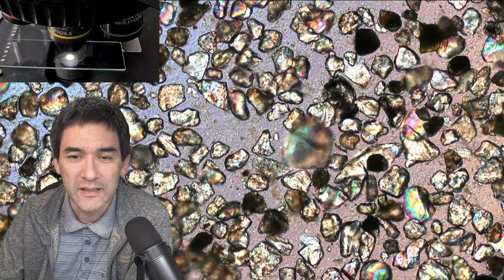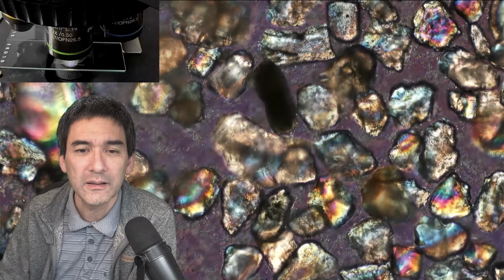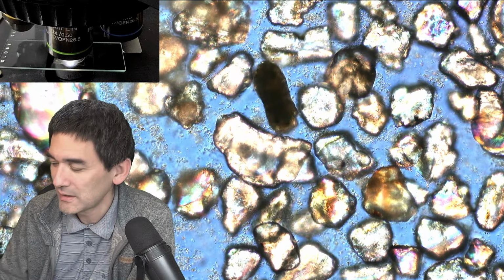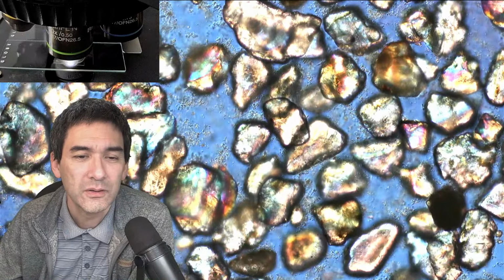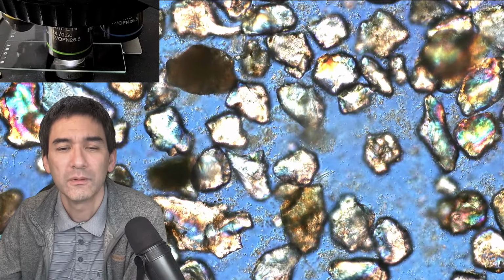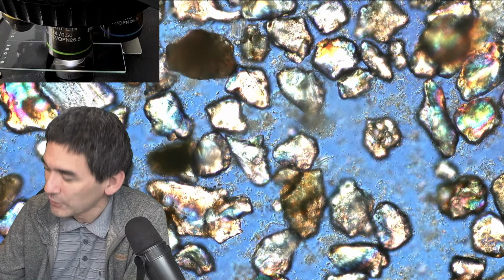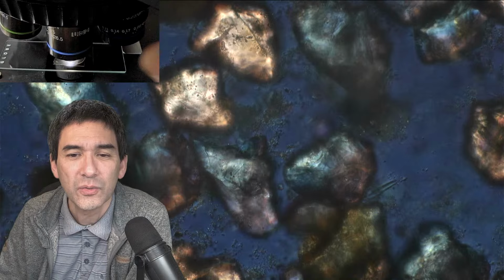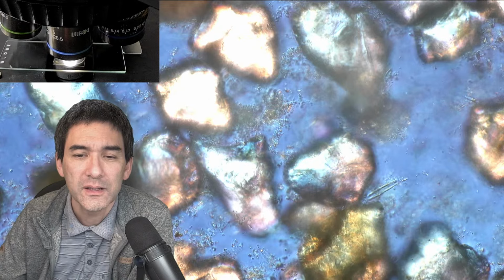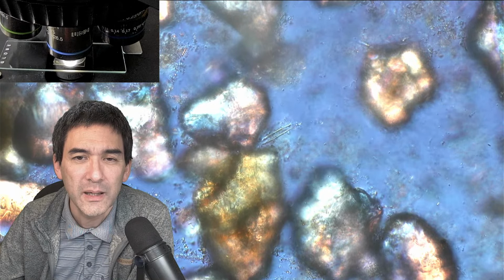But just looking at this, there is no movement, right? The sand grains look nice, sure, but if there's no movement, it's very difficult to actually see what's there. So that's a little bit the pity. The whole thing does look kind of dead. I'd have to go up, but I cannot go up with the magnification very much more because it's so thick. Let's have a look. This long thing in the center might be a diatom.